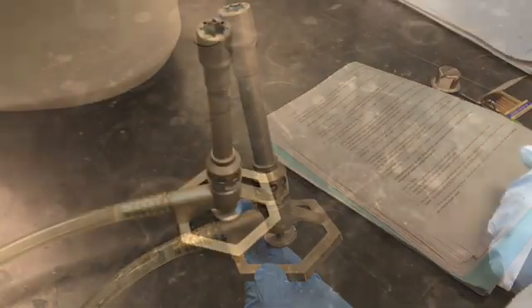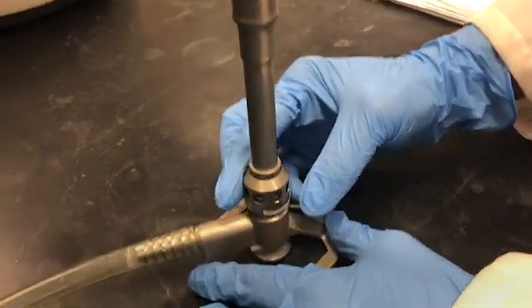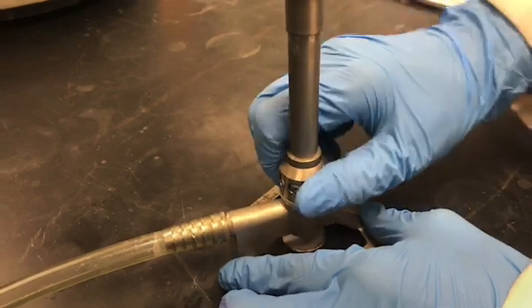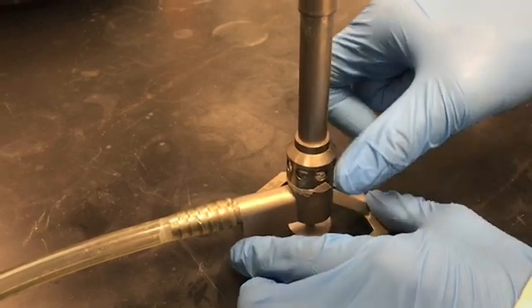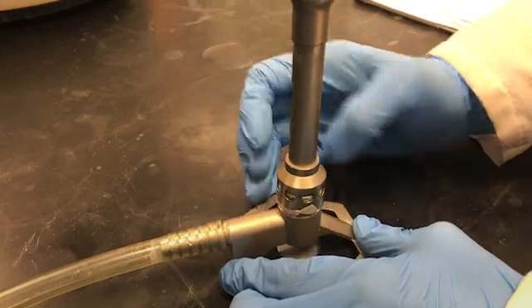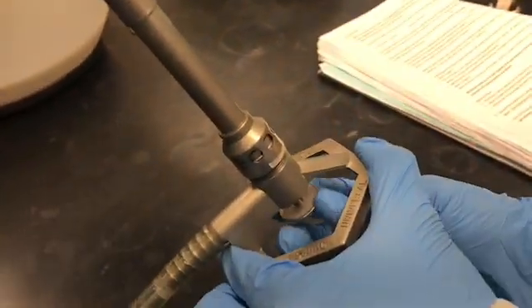Now we're going to get the burner ready to use and light it. First, gently close the barrel completely by lowering the body as far as it can go. Then give about four full turns in the opposite direction to open it and supply air: one, two, three, four. Then close the gas needle valve completely.